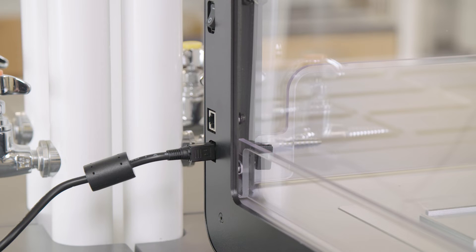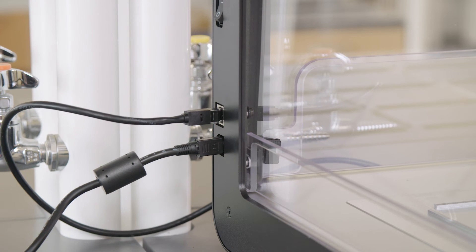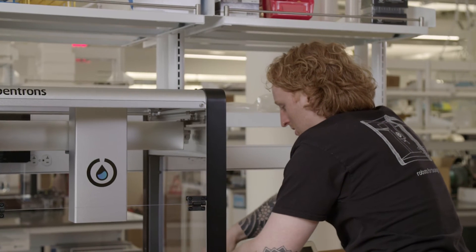The OT2 has an ethernet port on the side of it, just above the power port. I'll plug the ethernet cable in first and sneak it around to my computer.